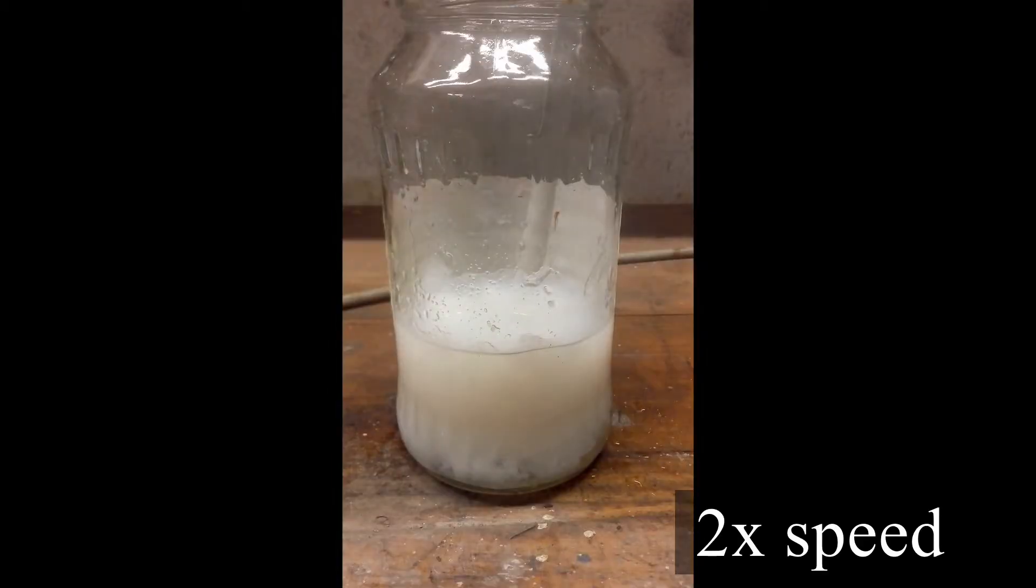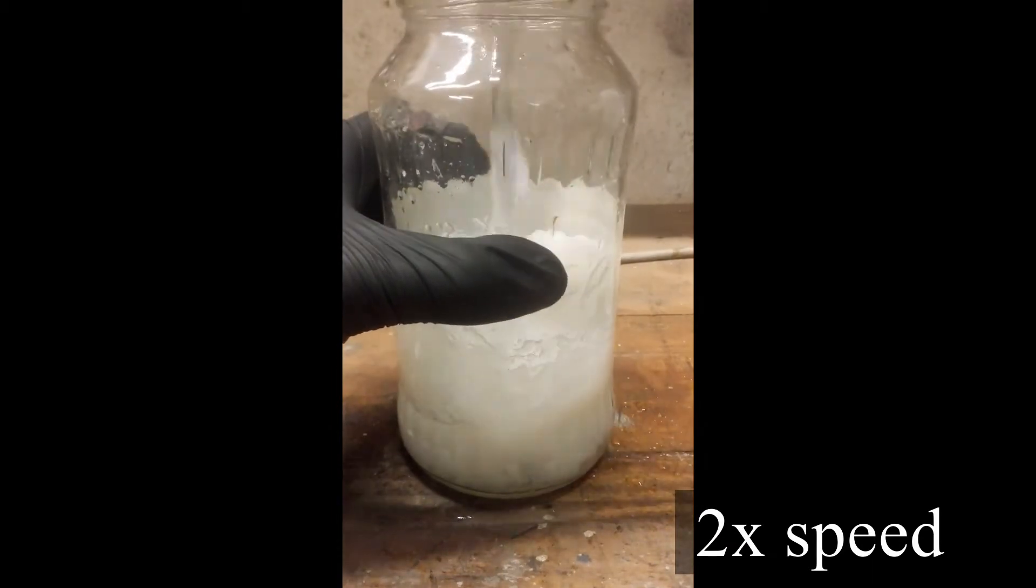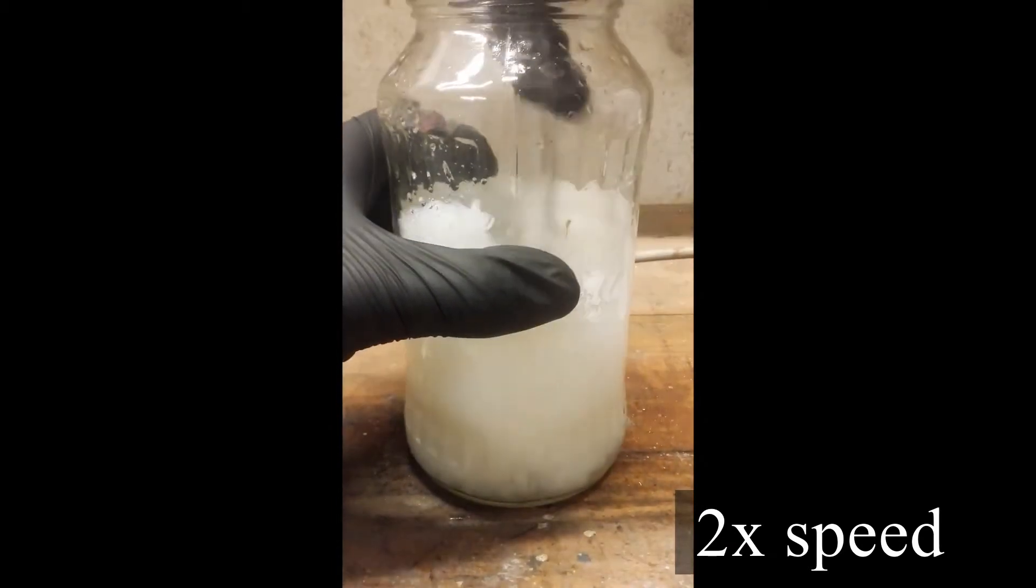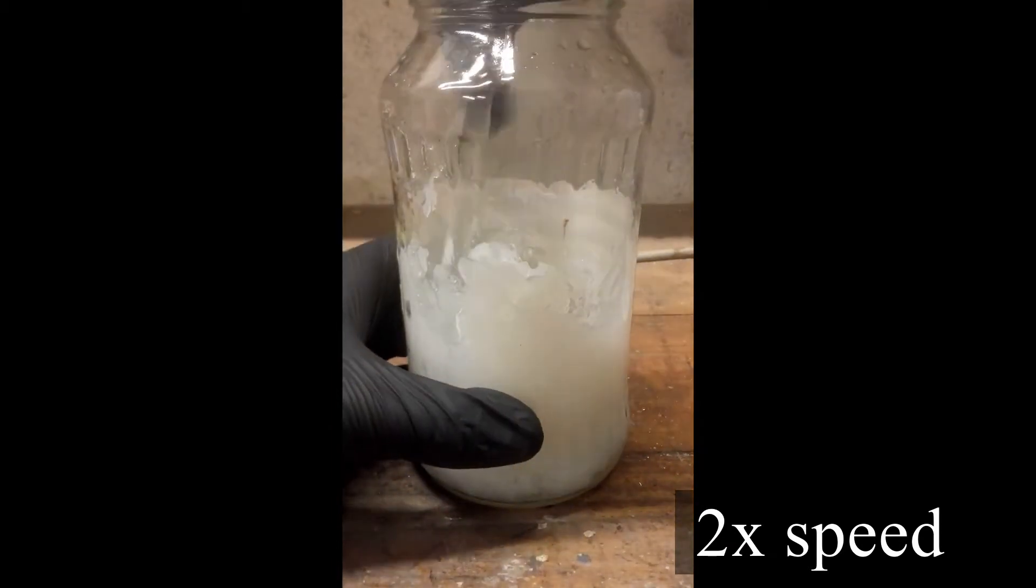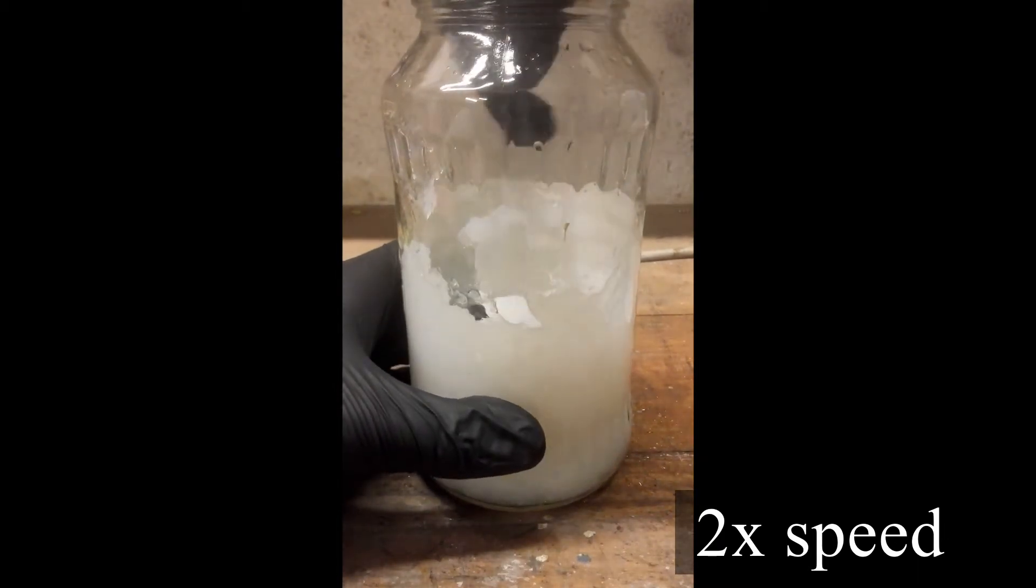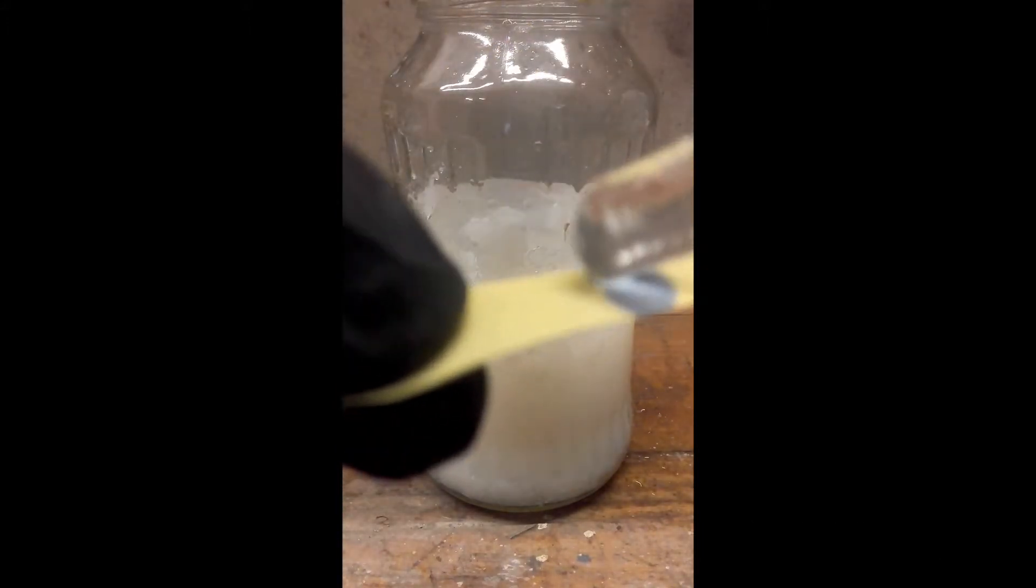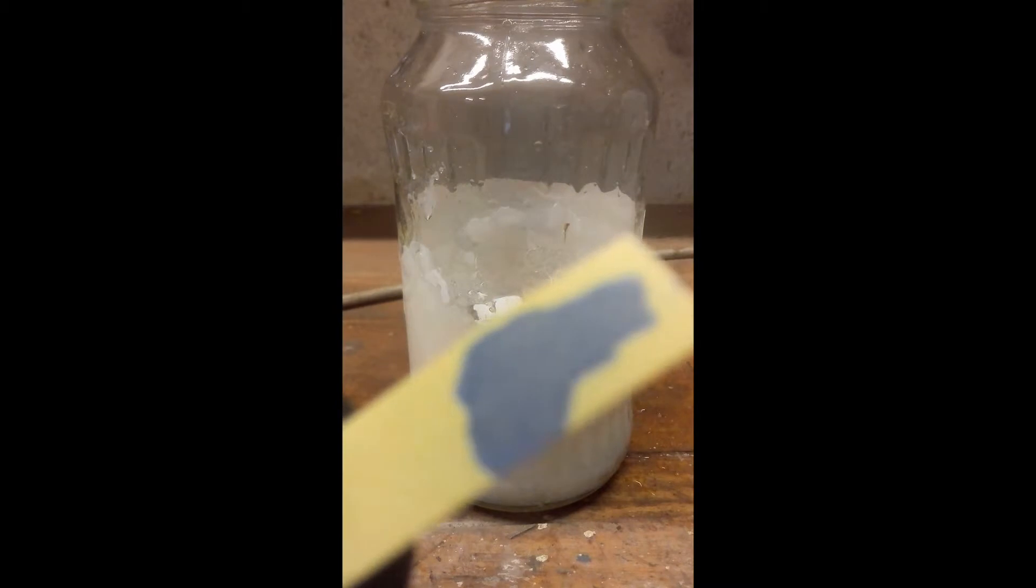Now the pain in the butt starts. Add a lot of water, stir, add water, stir, and also check the pH. If it's basic like in our case, add some HCl until it's acidic. The liquid glass solution we bought contains most likely some other stuff like hydroxides or other basic components, that's why we had to add more acid.